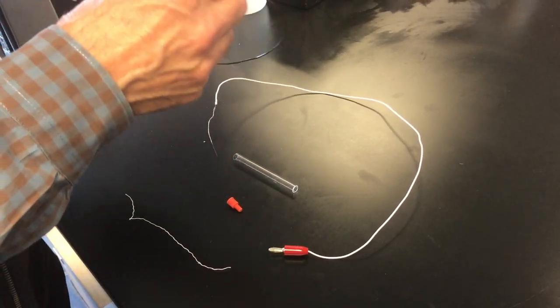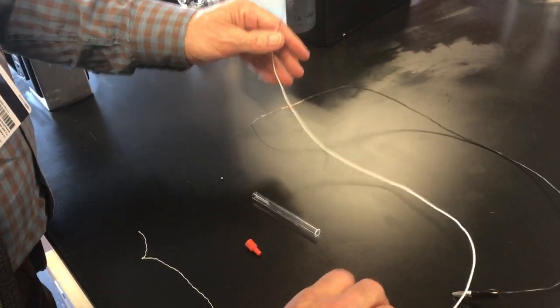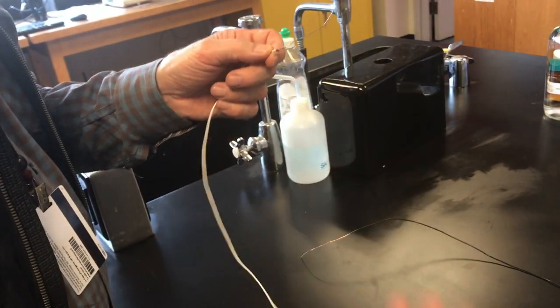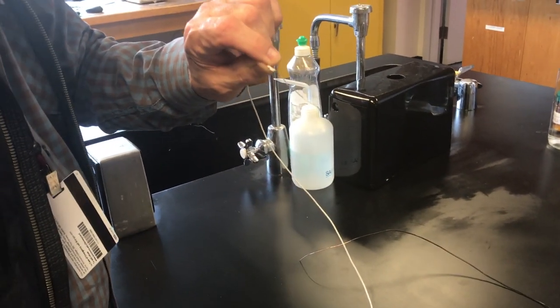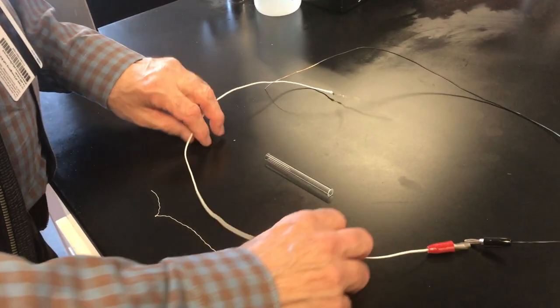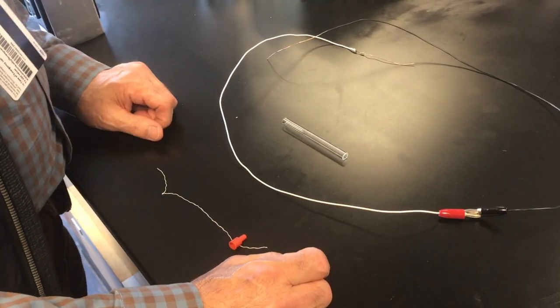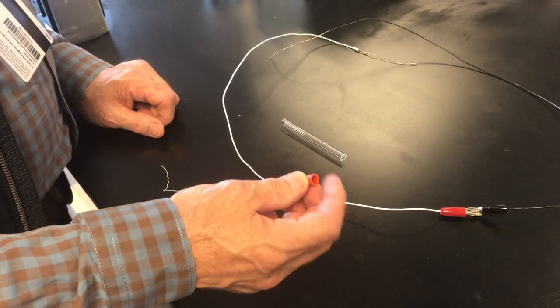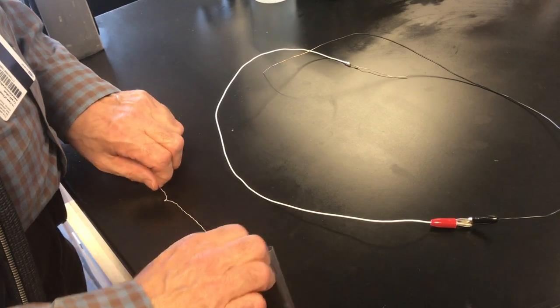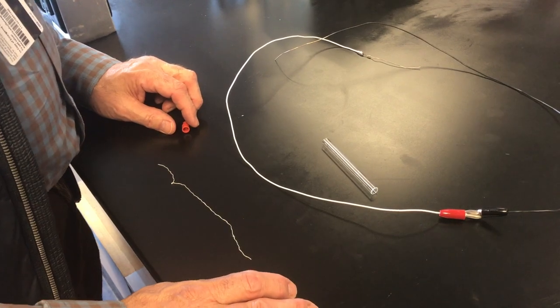It's copper on one end, and the other is the silver electrode, which goes into the other end of the multimeter and has a silvery antenna. The other pieces are unique — this is going to be the body of the electrode, this is going to be a septum to hold the fluid in, and this string is going to make our salt bridge.